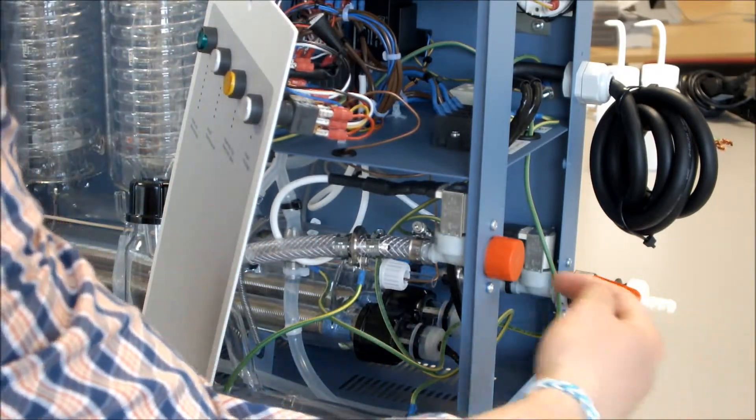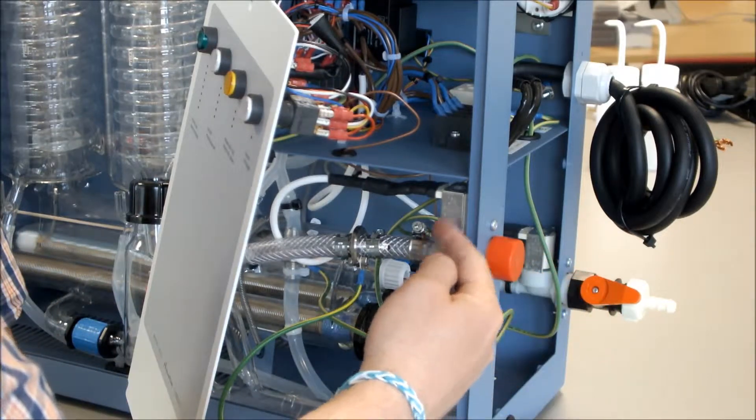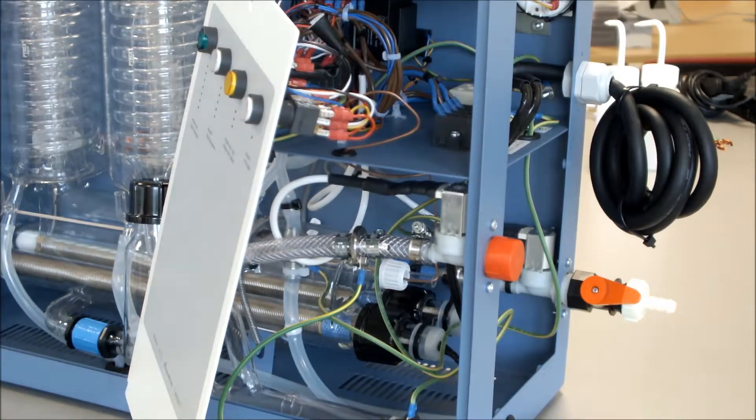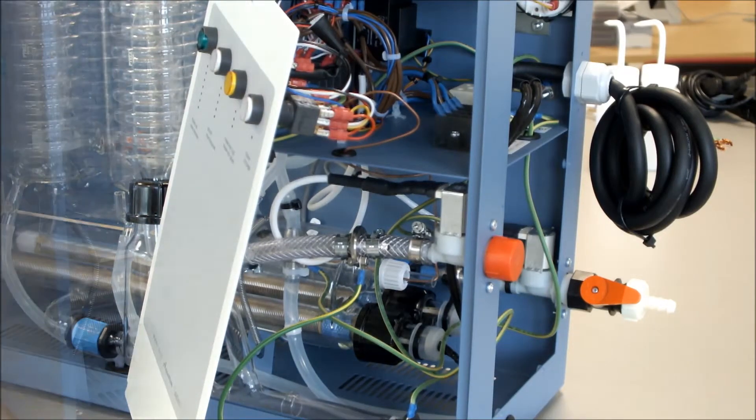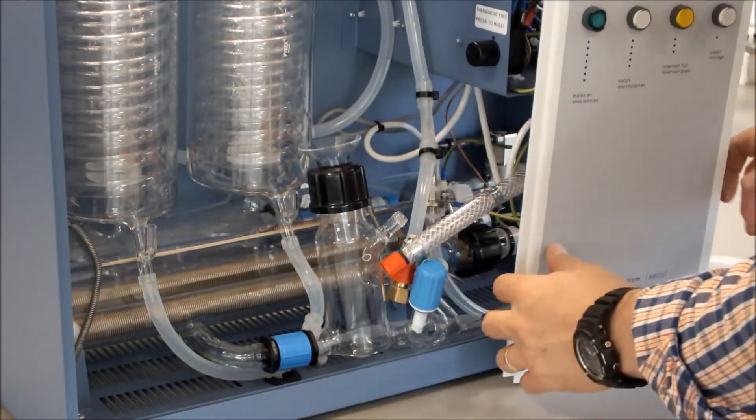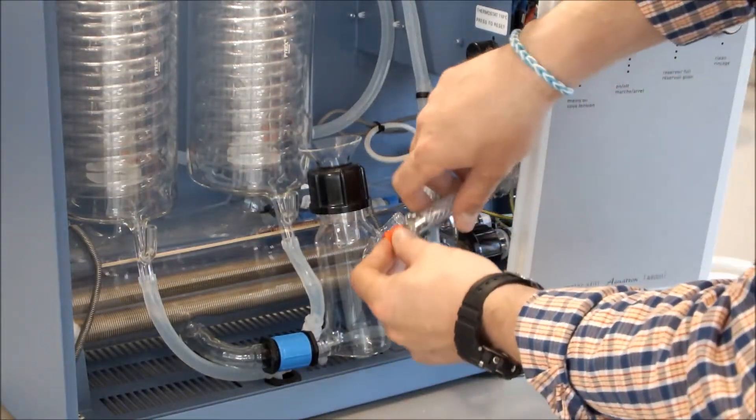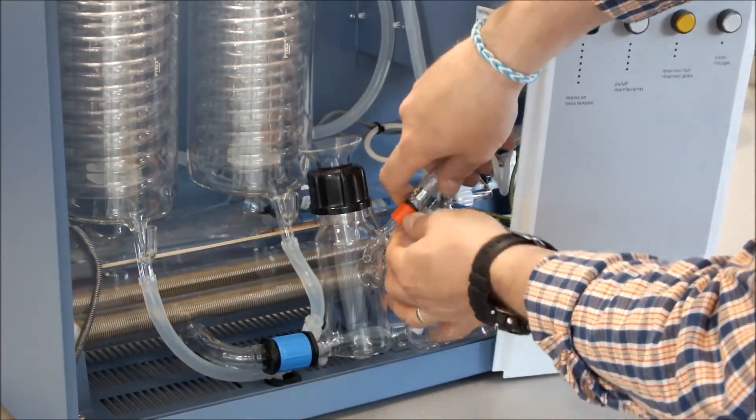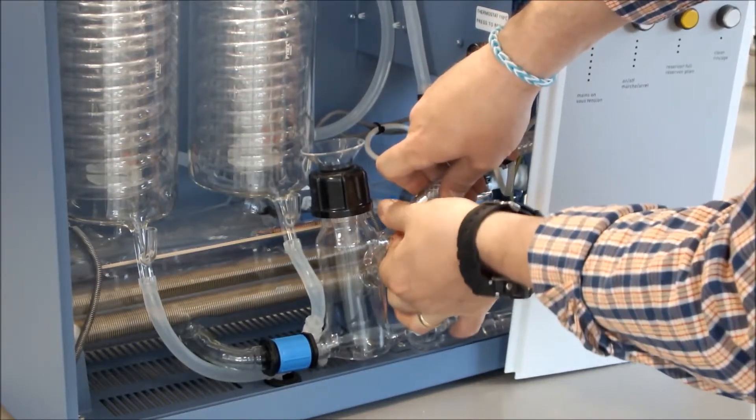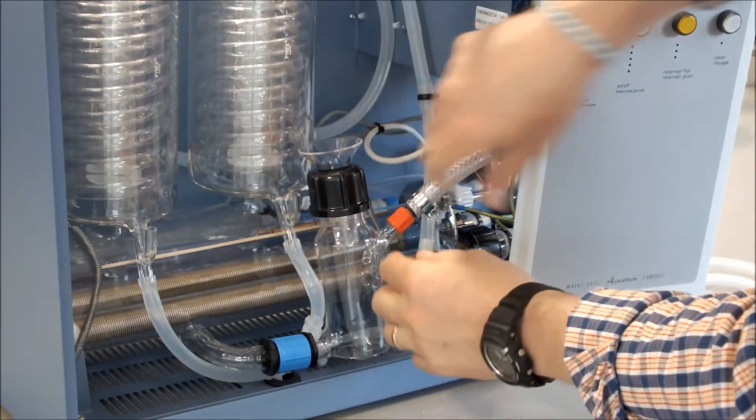Your deionised water can then come through your solenoid and through the pipe. The connection from our deionised pipe assembly is then connected to our boiler level control.